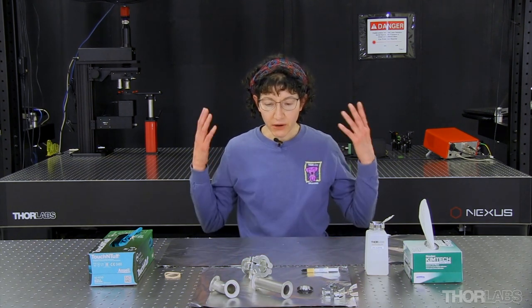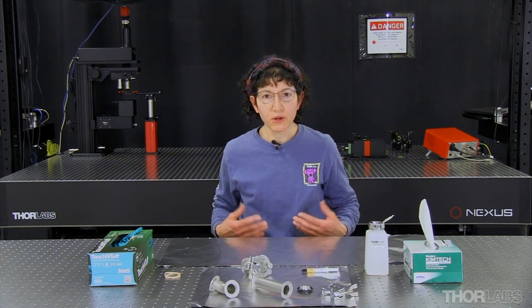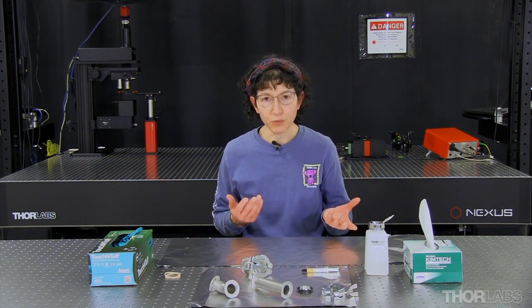Because of that, you'll typically see people wear a hairnet, lab coat, booties, and gloves when working with vacuum components or open vacuum systems. The gloves should be powder free. The powder in gloves is a significant contaminant because it will be scattered everywhere when the gloves are put on, when they're taken off, and when they rip.